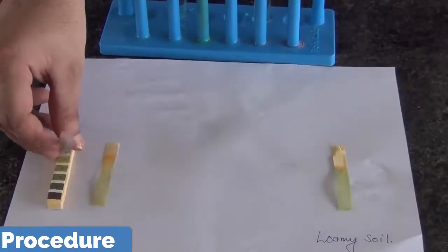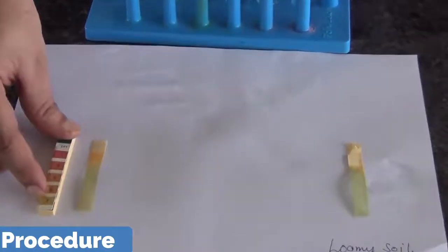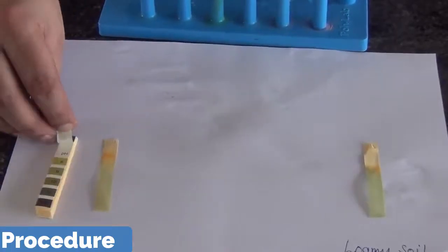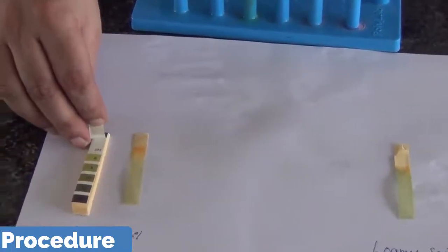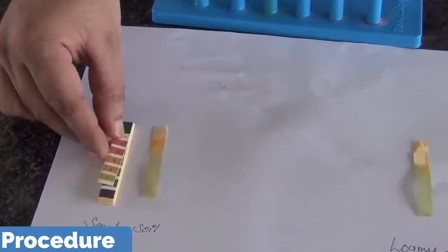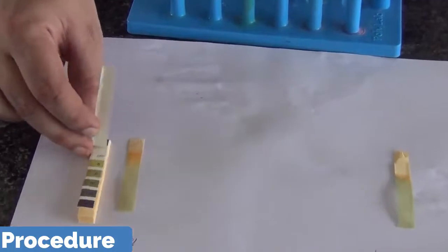See, these are the colors indicating the pH, and you can see the sandy soil is matching with pH 8, somewhere between 7 and 8. It is closer to 8.